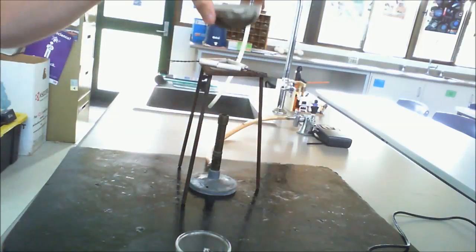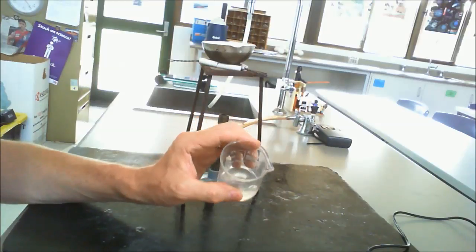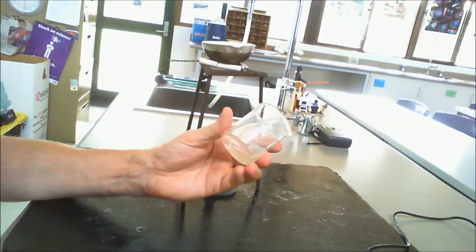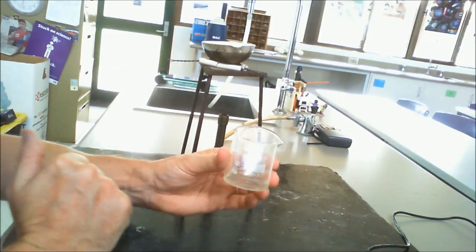Okay. Now what we then need to do is we are then going to evaporate off. So what we've got is we've actually got a liquid being formed here. So the idea for the prac is to work out what you end up with. So we know that we've produced a gas because that was the initial reaction. We know that we've produced water.